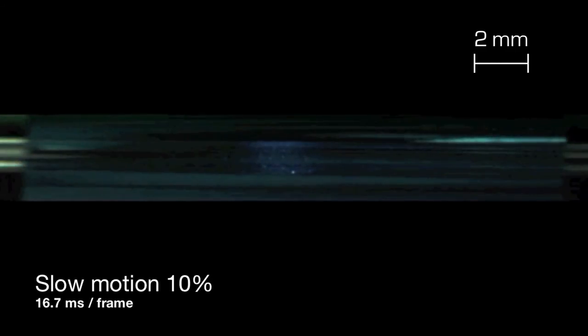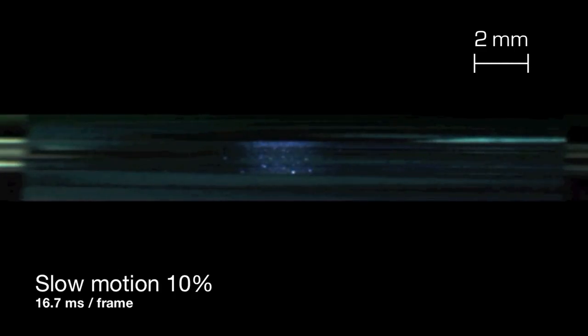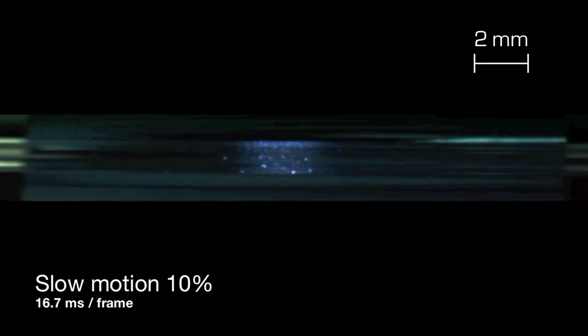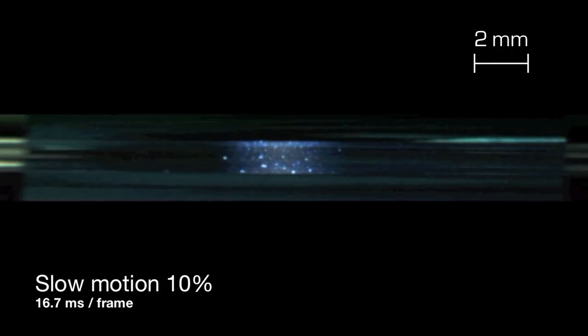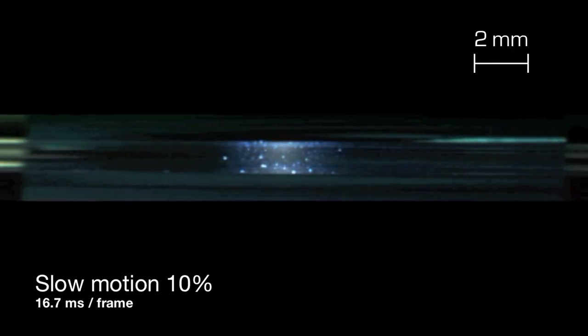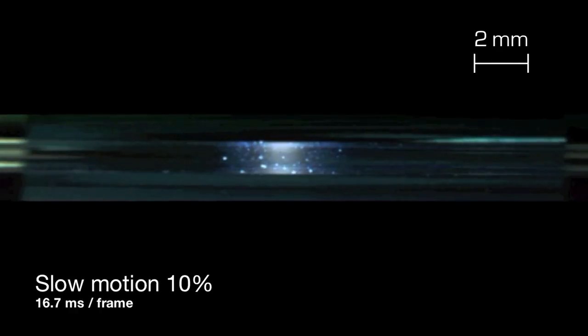All this happened too fast for most of us to follow, so let's take a closer look at a few details of the pull. During the initial heating phase, dust particles light up first. Even though the capillary in this video was clean, small dust particles cannot be completely avoided with reasonable effort. In the video they help us judge movement of the glass.